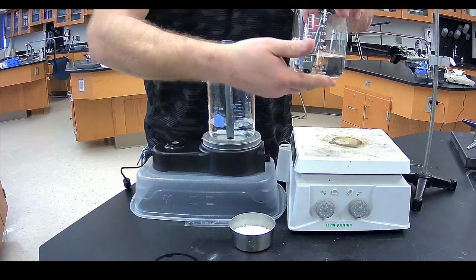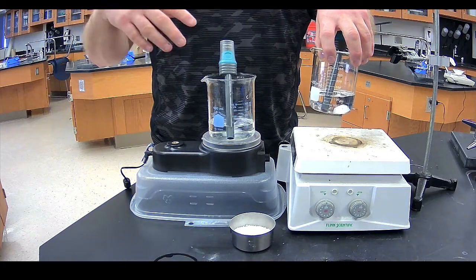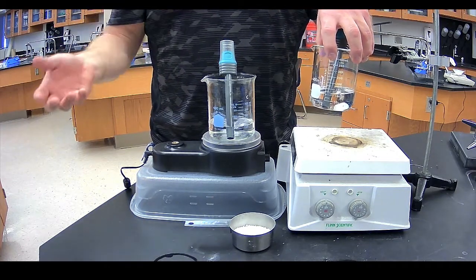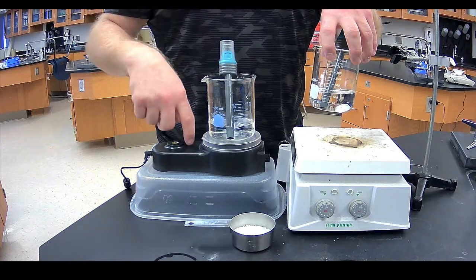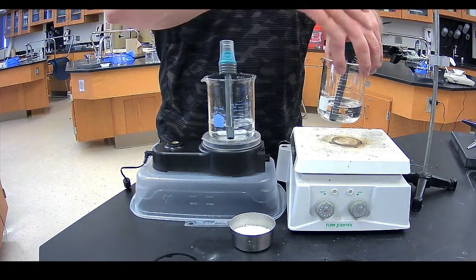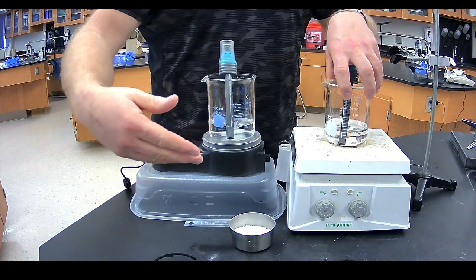And then in each of the beakers here, I have 100 milliliters or 100 grams of water. Okay, and what we're going to do is put them both together, start them at the same time, and take a look to see how the solubility is affected by temperature. Now, on my side over here, this is going to stay at room temperature, and all this device is doing here is stirring the solution for me. On my left-hand side, this is going to warm it up and stir both once we get started here.